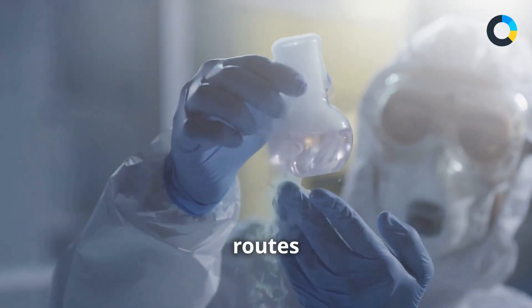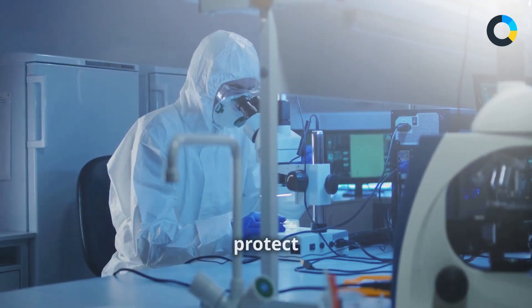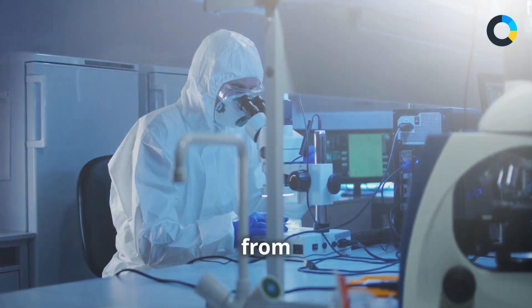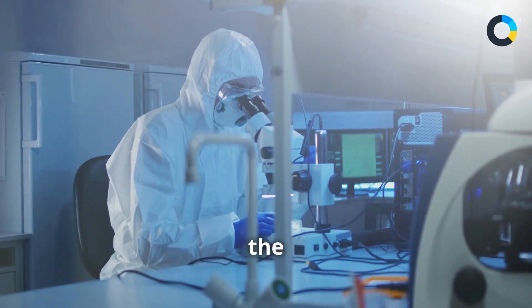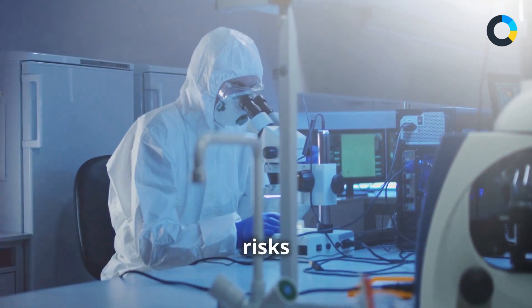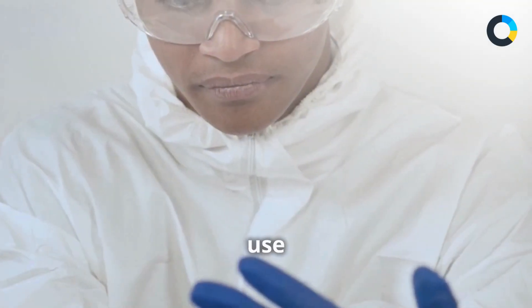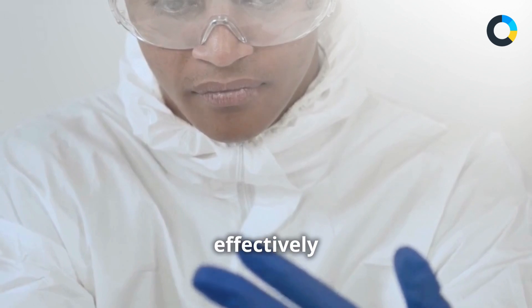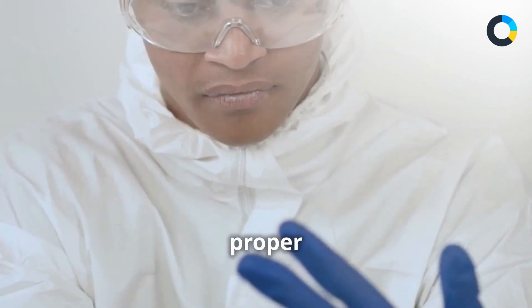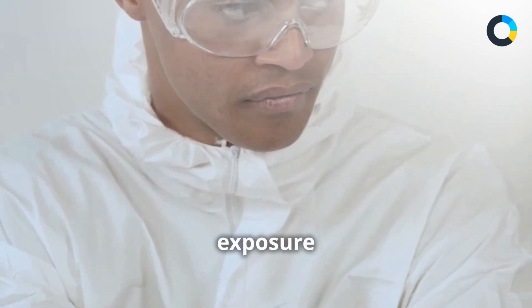Understand the routes of chemical exposure and how to protect yourself from inhalation and skin absorption, the most common risks in a lab setting. Learn to use personal protective equipment effectively and follow proper lab protocols to minimize your exposure to hazardous substances.